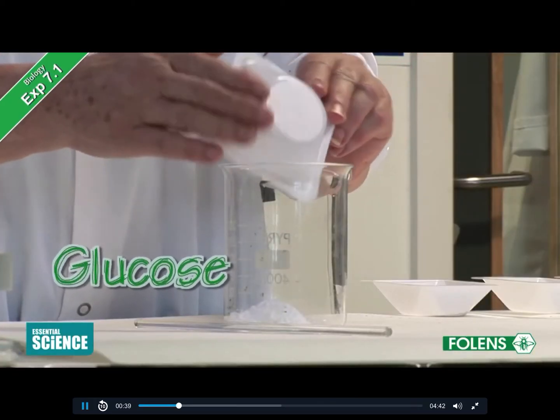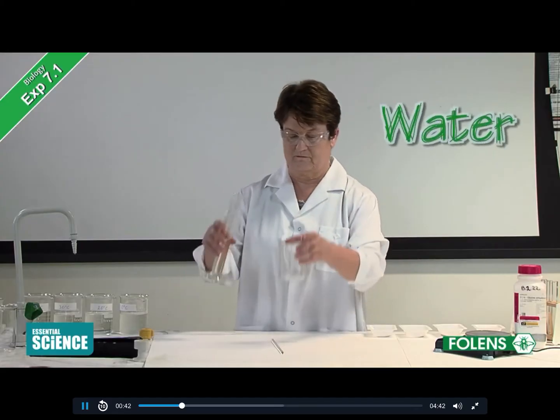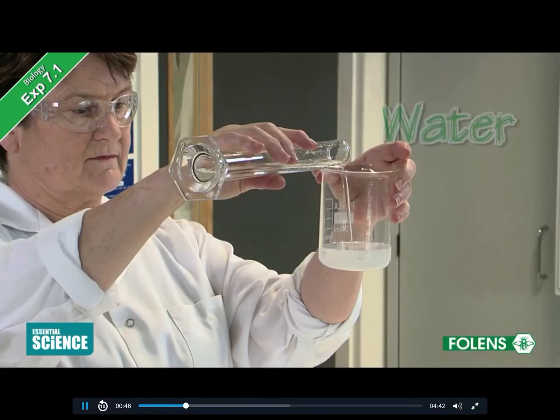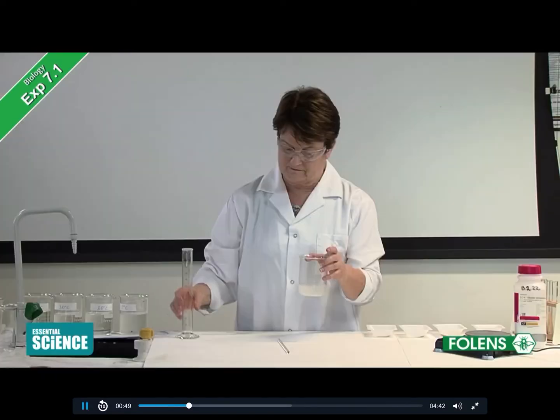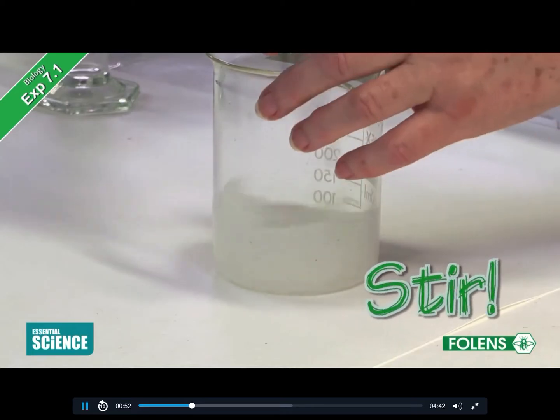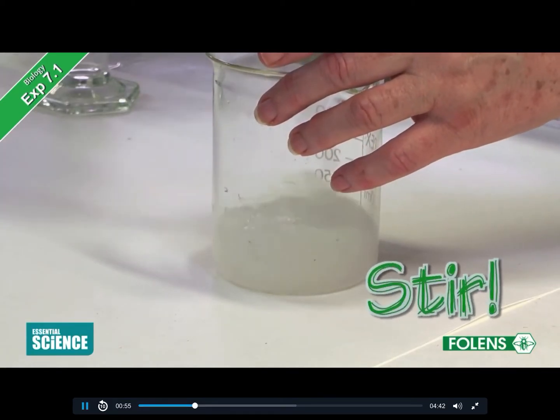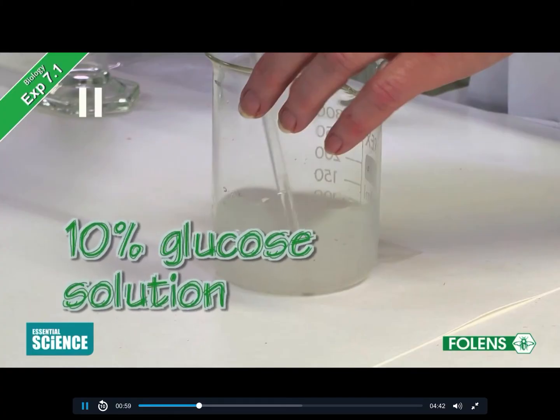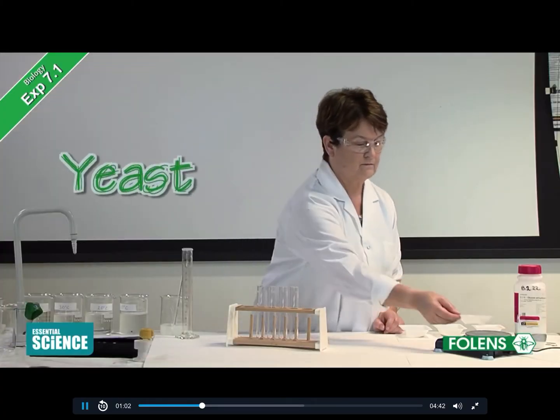10 grams of glucose is added to a beaker. Water is added to make the solution up to 100 millilitres. The solution is well stirred. This is a 10% glucose solution.